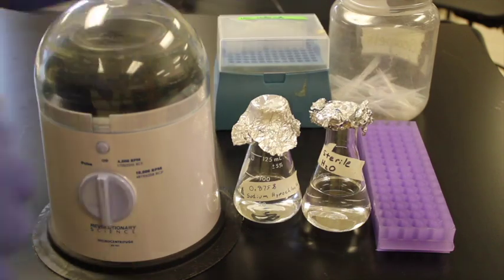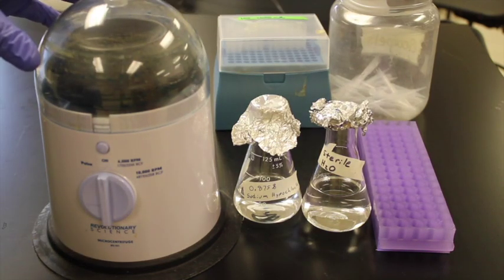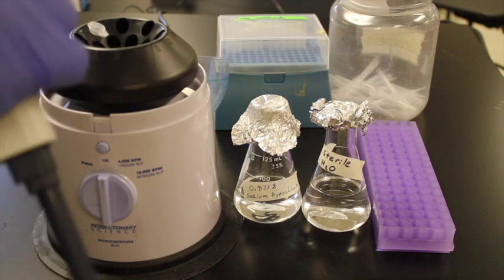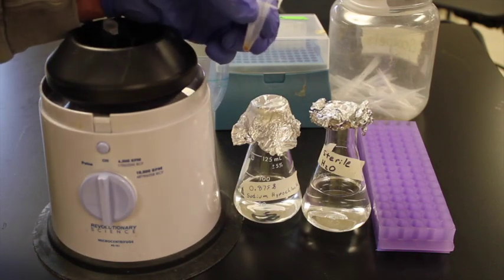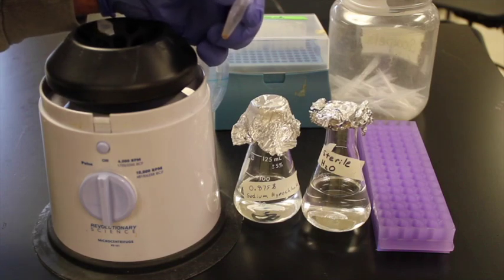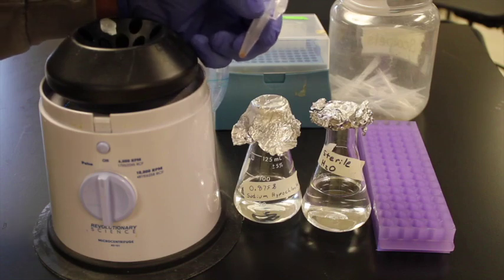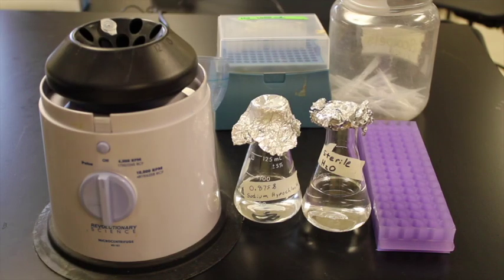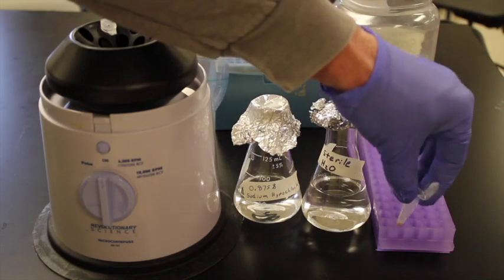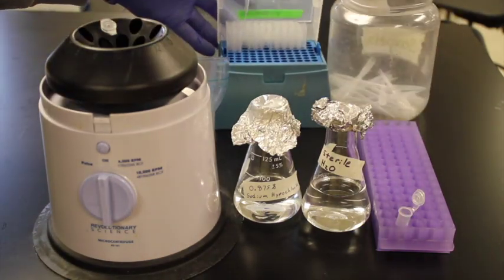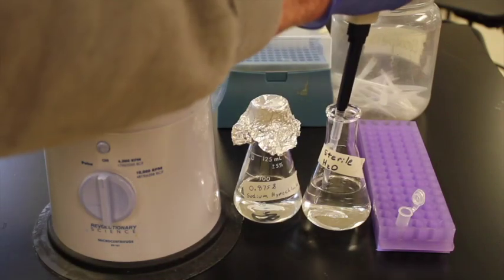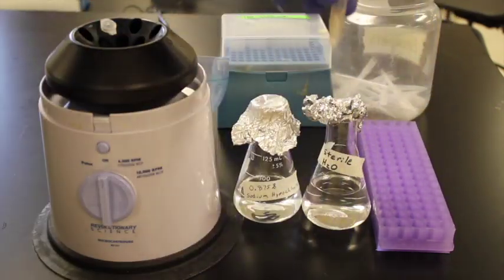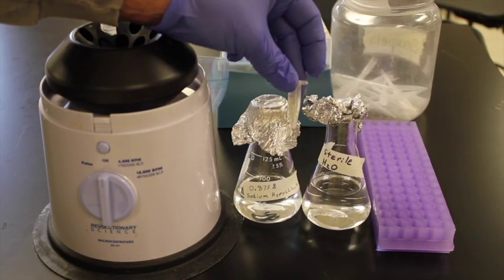Get all the cells down in the bottom. Take down the pipette tip. Go a little slower this time. Open this up. Get the cells. Carefully suck it all out. Change my pipette tips. Add water. And we are finished. So those are now a big vial full of sterilized cells.